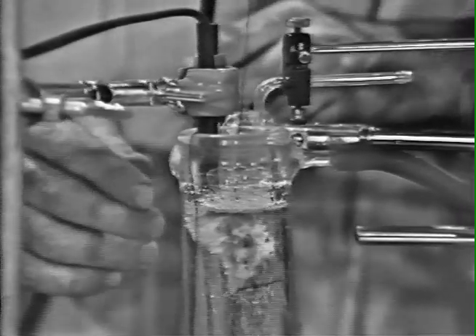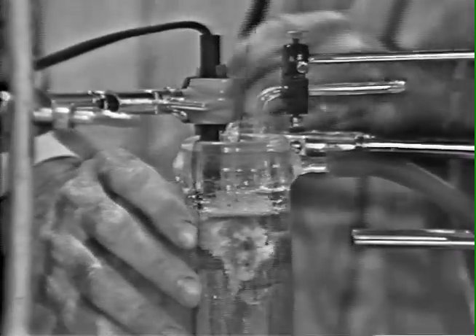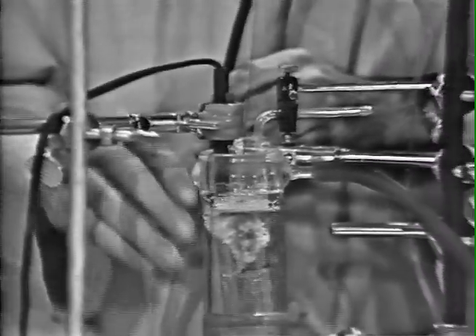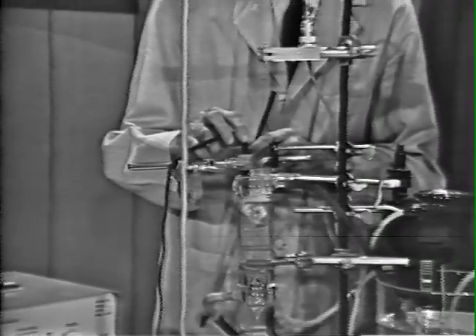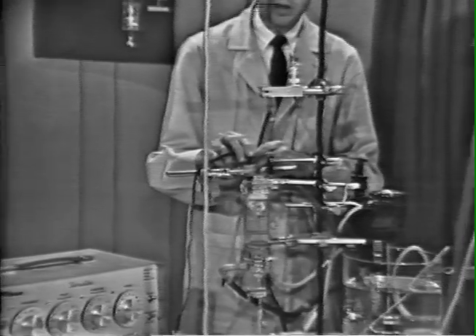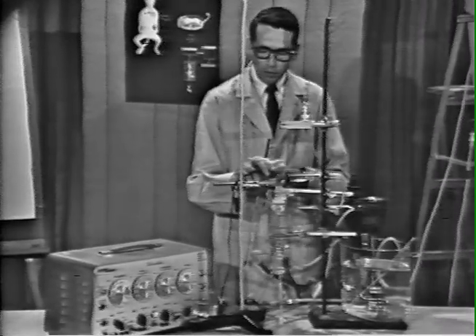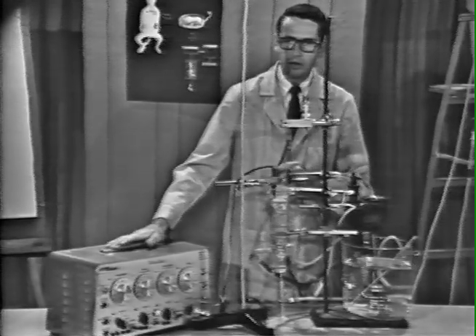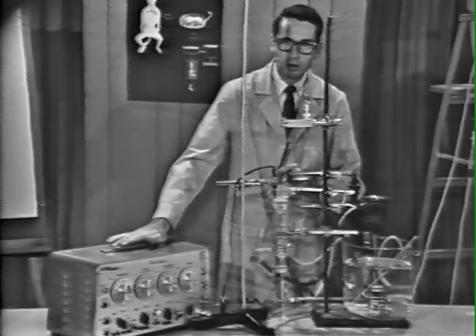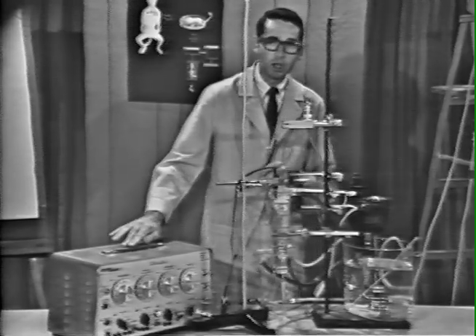It is also possible to stimulate the nerve. In this portion of the demonstration, that is what we will be doing. We have an electrode, which is a double-pronged platinum electrode, situated at the surface of the bath, with the nerve lying over the two prongs. We apply stimulation to the nerve via this Grass stimulator, and we are able to use stimulation of various frequencies, voltage, and impulse duration.